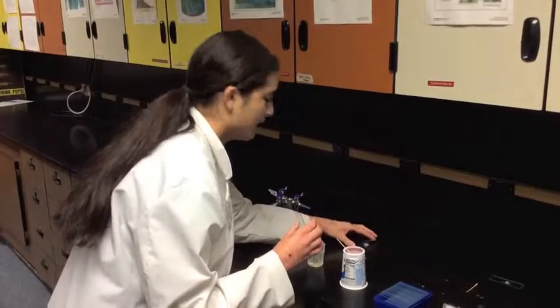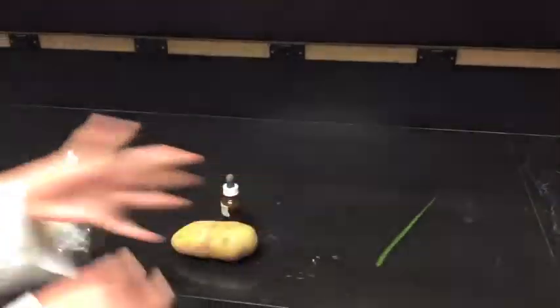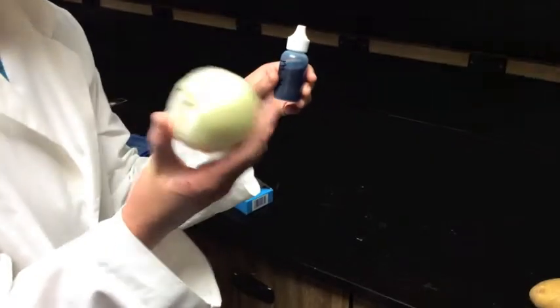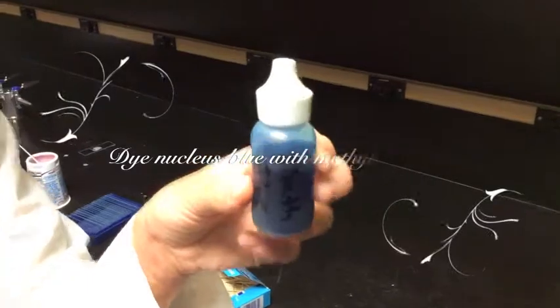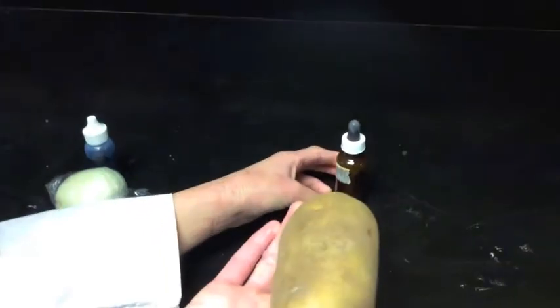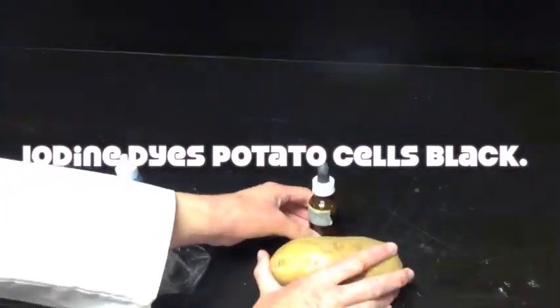After yogurt, we will do plant leaf cells, and we will place those in slides with water as well. Then we'll be doing the onion — your teacher will help you cut it — and you'll put methylene blue on it. Then we'll do potatoes; your teacher will help you cut those too, and then you'll put iodine on it.